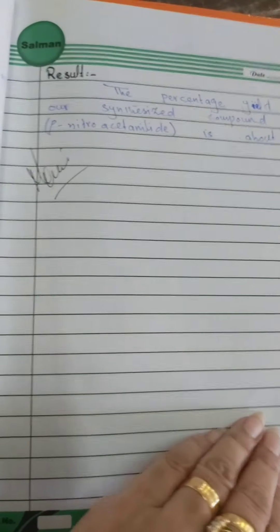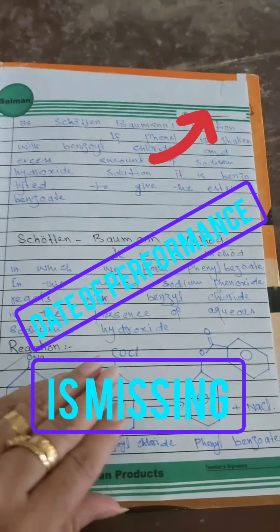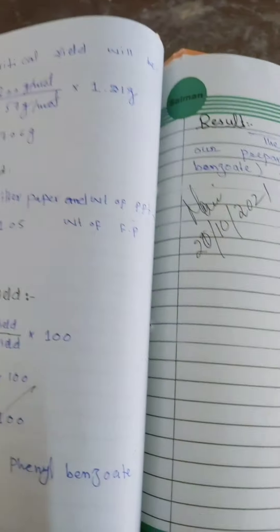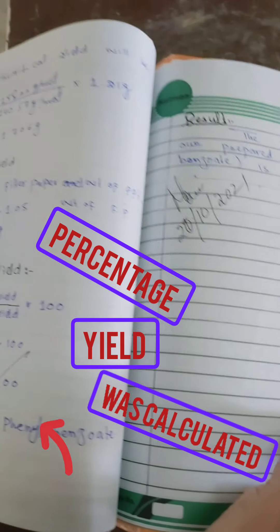This section shows the theory, the reactions, the procedure, the calculations, and my signature from the first experiment. This is actually experiment number two — they are currently performing the third. One group is performing the experiment while the other group, who are not participating in this round, are preparing their journals and doing rough readings. The boys are doing rough readings and will transfer them to their fair journals. That is how the experiment goes on and it will reach its finishing line soon.